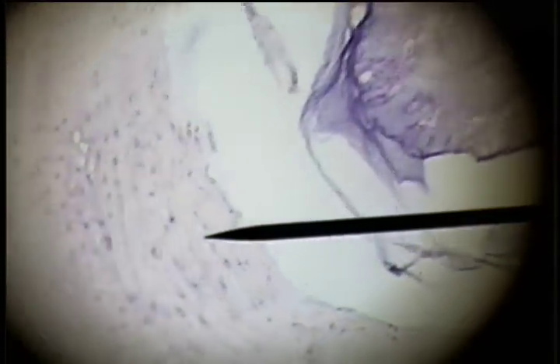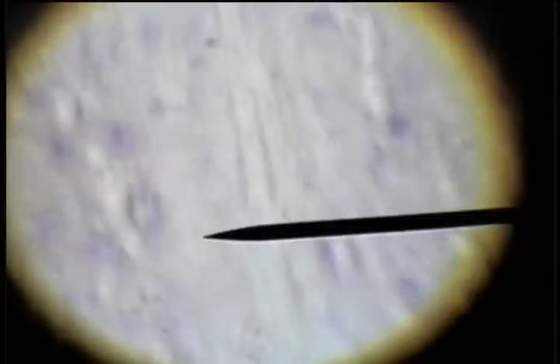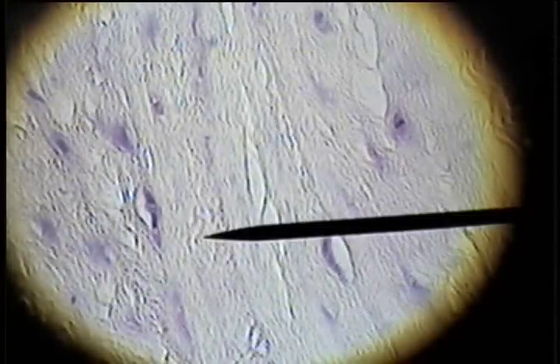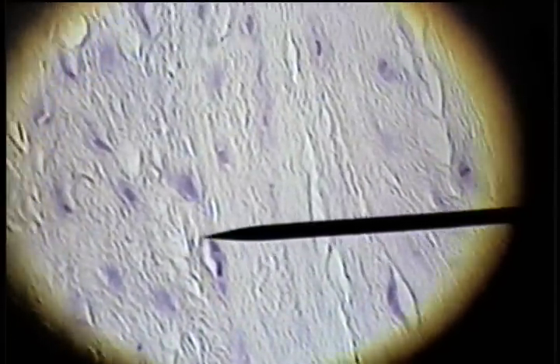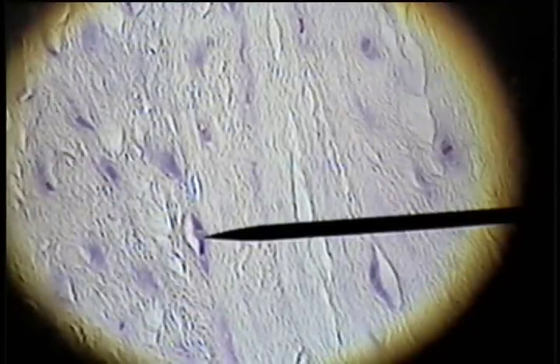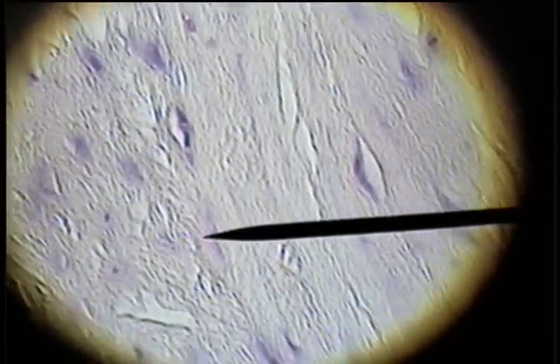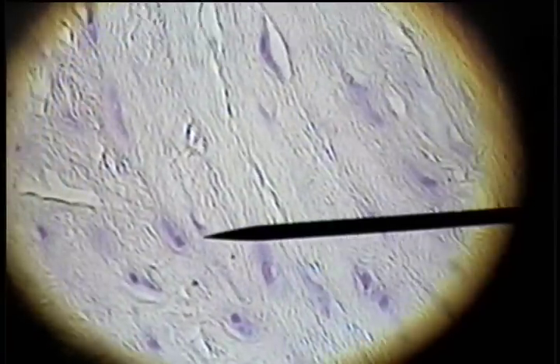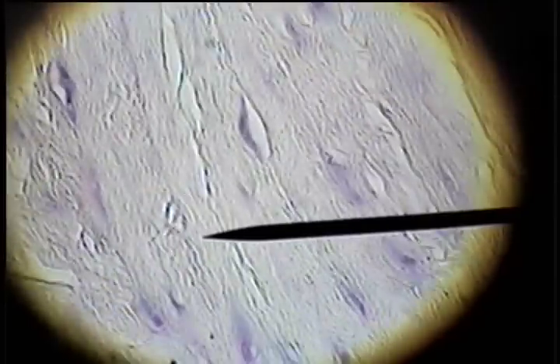At lower power, there is no perichondrium on either surface of this fibrocartilage. At high power, the fibers appear as a coarse, white, wavy collagenous material. Here is a lacuna with a chondrocyte, and the chondrocytes of fibrous cartilage tend to be oriented in a line — they tend to be linear rather than scattered at random as in hyaline cartilage and elastic cartilage.